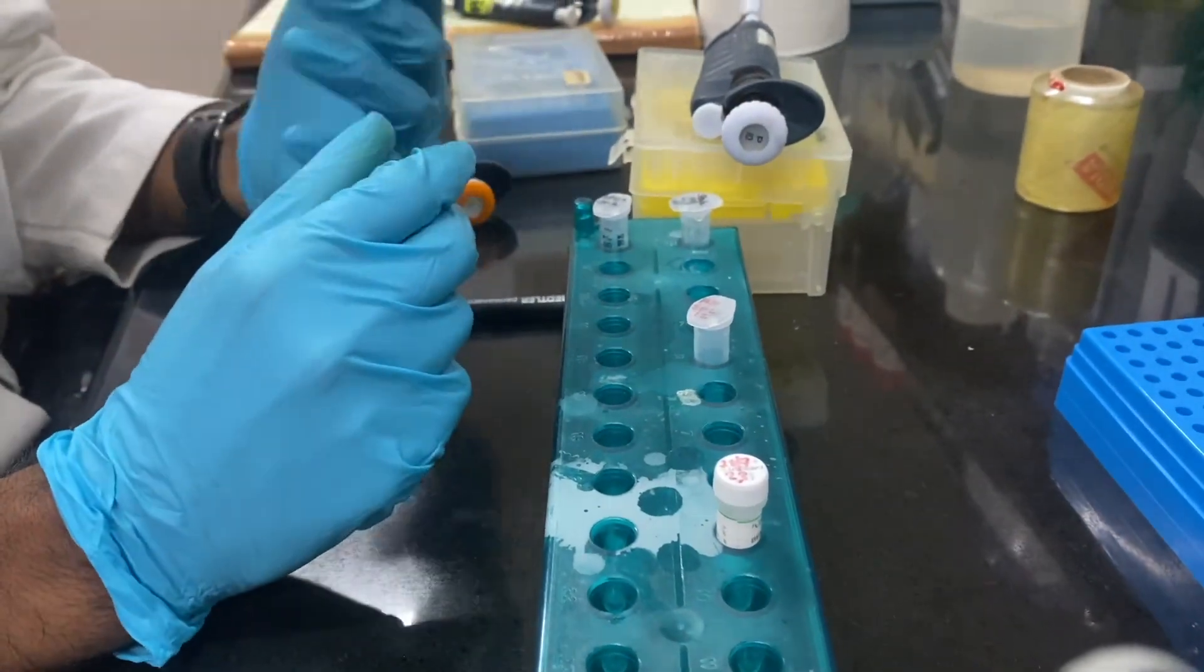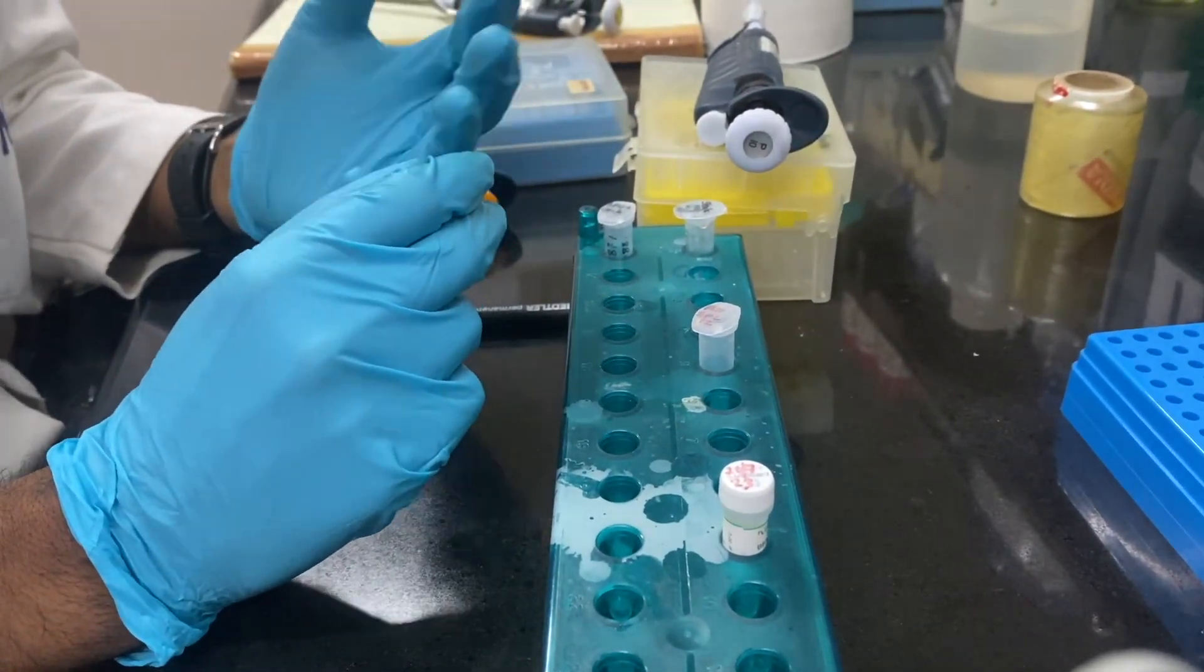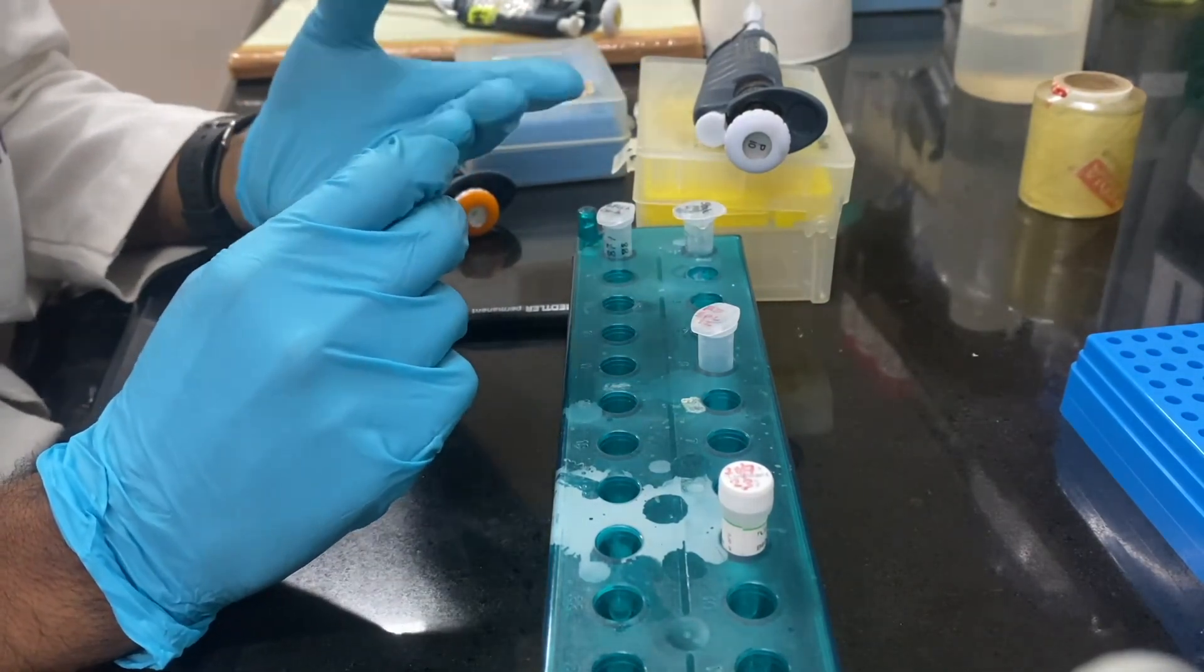Now buffer, nuclease-free water and the plasmid DNA have been added. Now we will add the KPN1 and followed by Sac1.